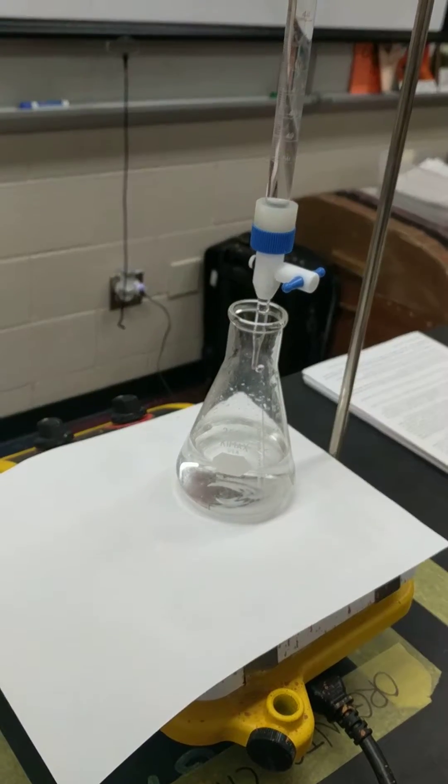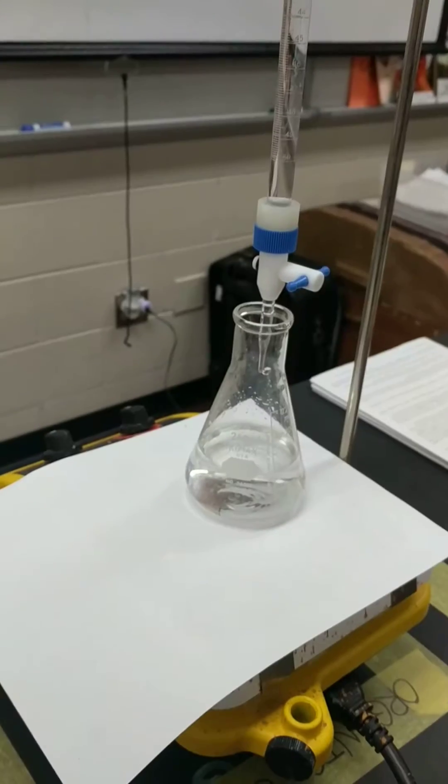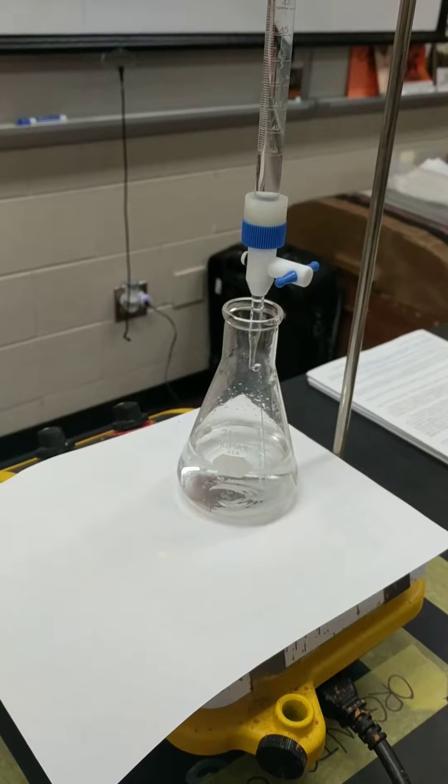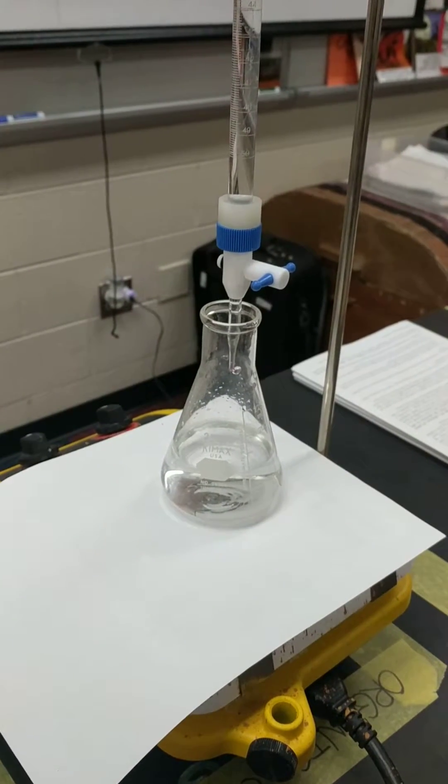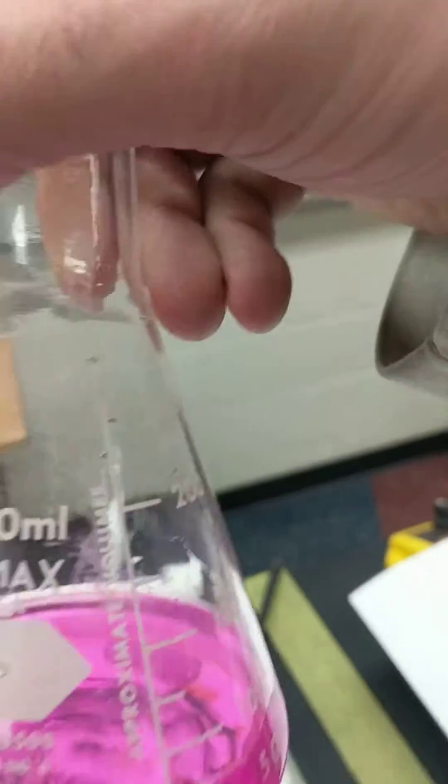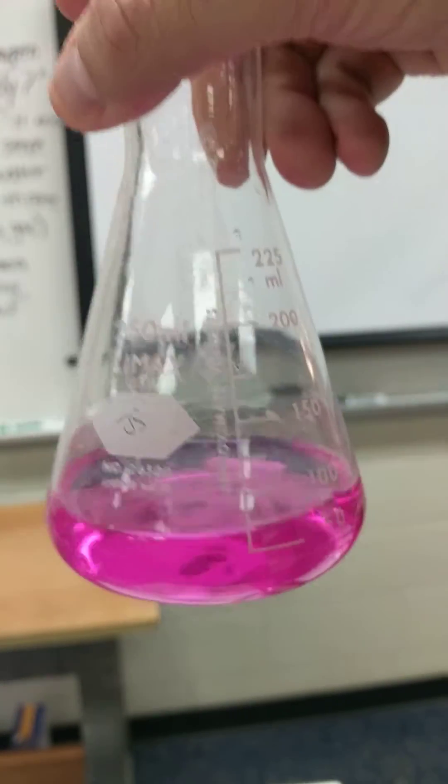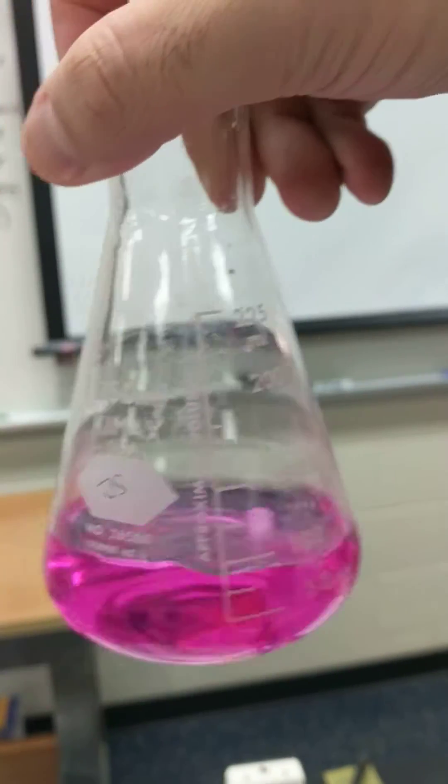All right, hey AP Chemistry. I wanted to show you what the best color of the solution would be. Now a lot of us may be getting to this point, but this means I have too much of my base in here for my titration.